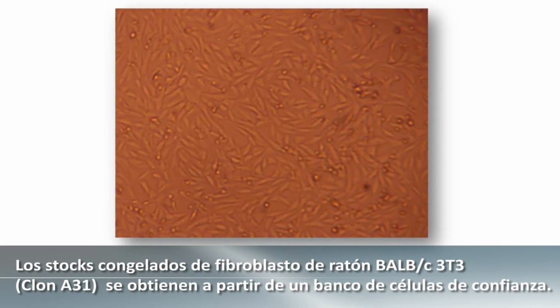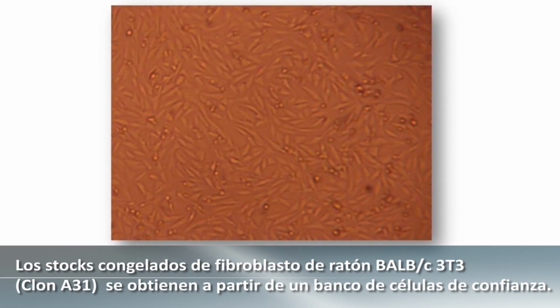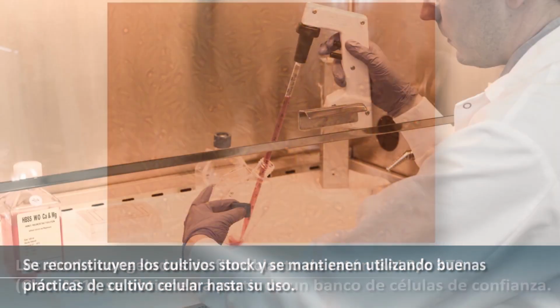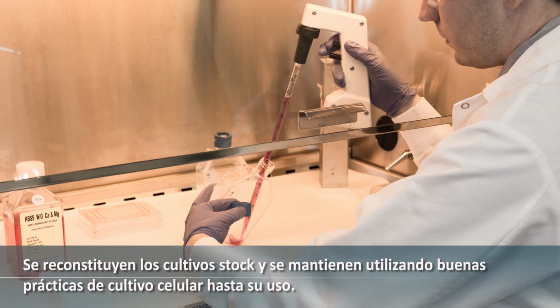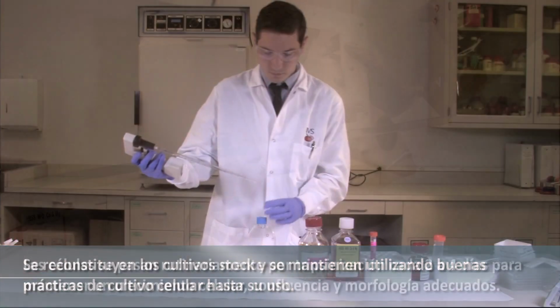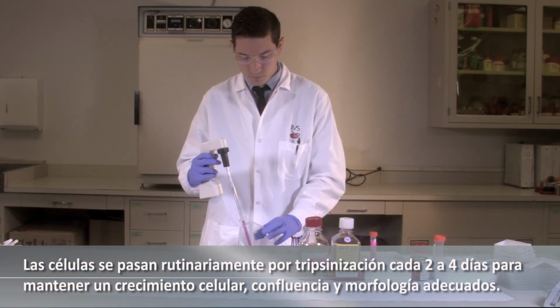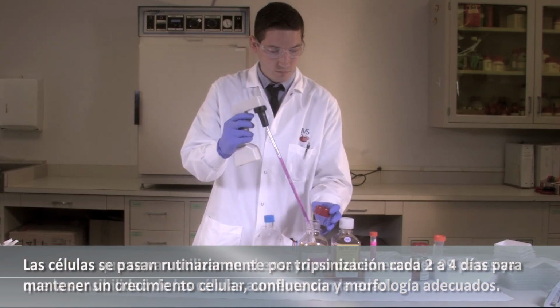Frozen stock cultures of Balb/c 3T3, clone A31, mouse fibroblast cells are obtained from a reputable cell bank source. The stock cultures are reconstituted and maintained using good cell culture practices until use. The cells are routinely passaged by trypsinization every 2 to 4 days to maintain proper cell growth, confluency, and morphology.